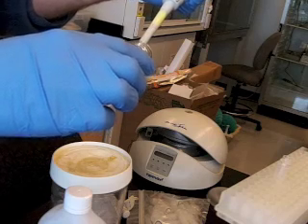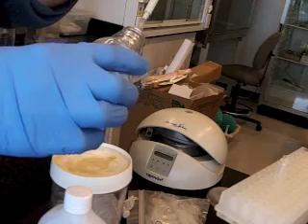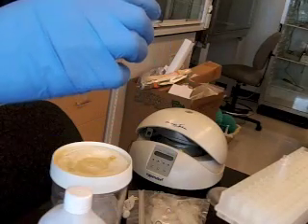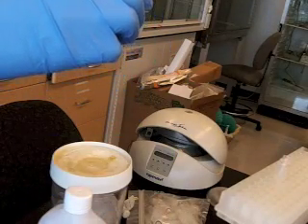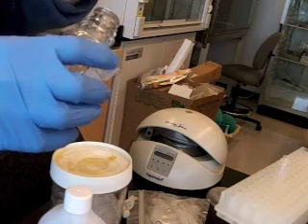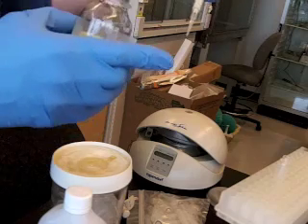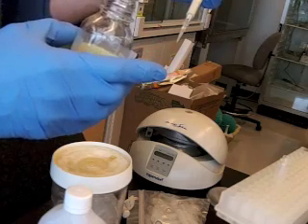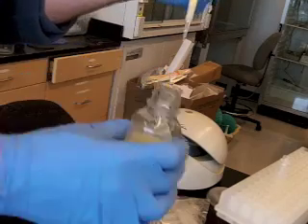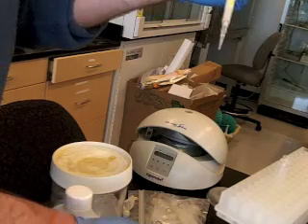And then, next thing I haven't mentioned is you want to watch yourself pipetting. So I kept this up close to my face so I could watch the pipetting to make sure that I didn't get any air bubbles, and that I didn't splash, and that I got the approximate volume I need. So over time you get used to seeing this and saying, yeah, it looks like about 100 microliters. I'll put the cap back on, and it's very nice to have that.